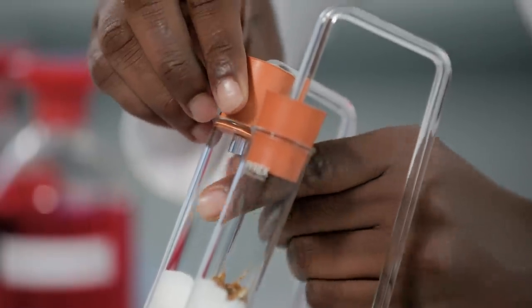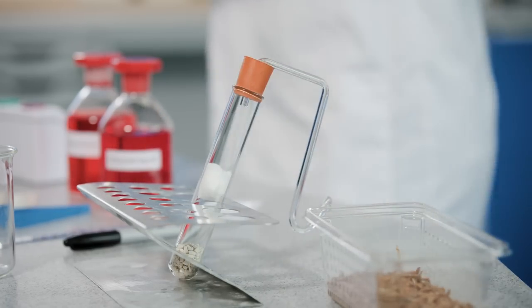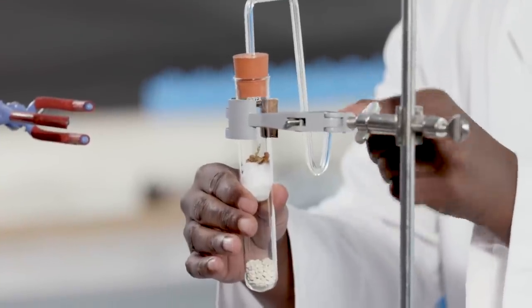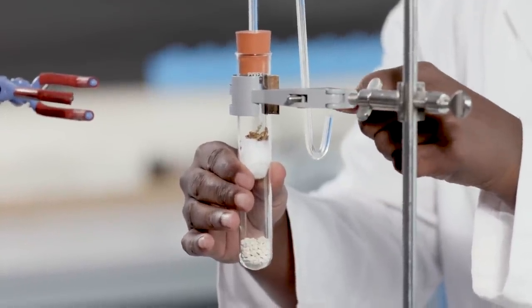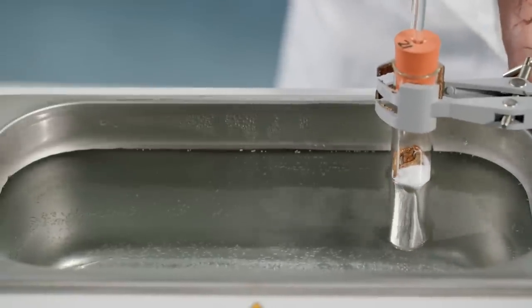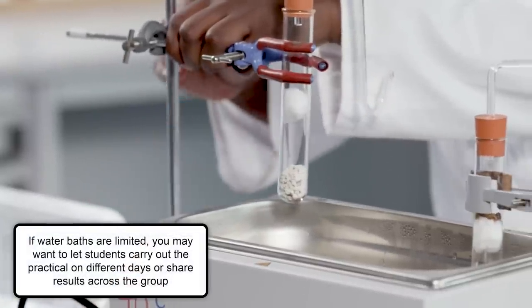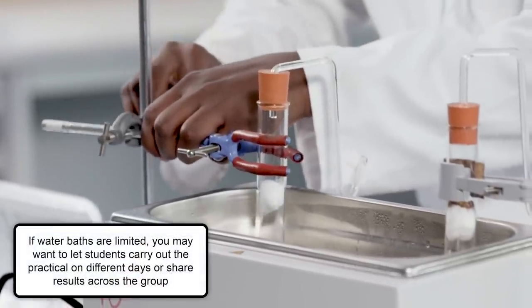Set up a control tube without the organisms. Place both tubes in a suitable rack in a water bath at preset temperature of 34 Celsius. It is best to tilt the rack slightly so that the capillary tubes hang over the side of the water bath at an angle.